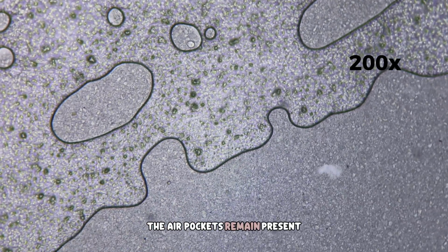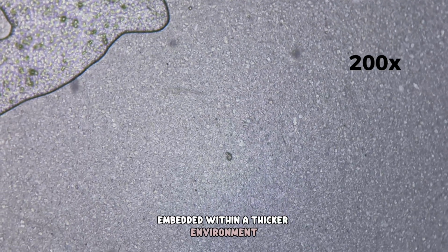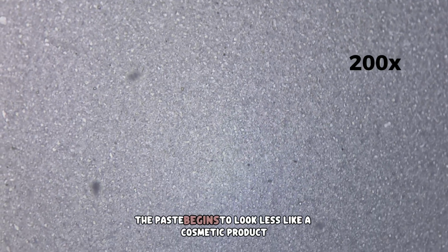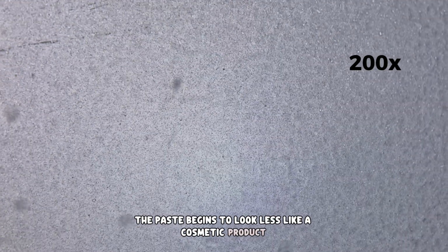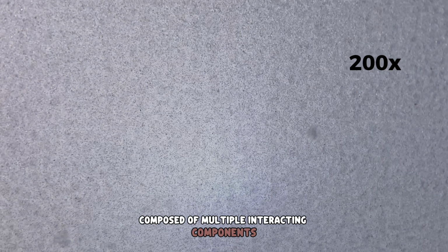The air pockets remain present, but they now appear more clearly embedded within a thicker environment that surrounds and stabilizes them. The paste begins to look less like a cosmetic product and more like a precisely engineered material composed of multiple interacting components.